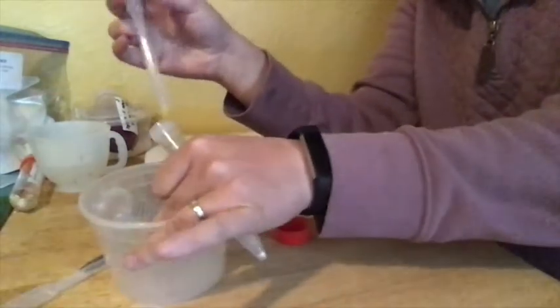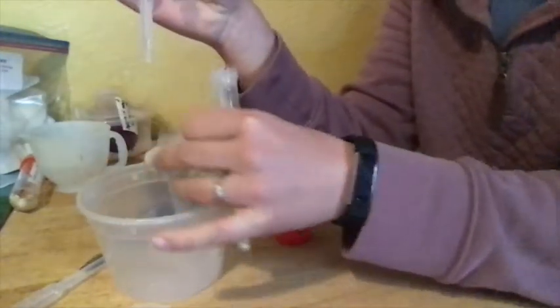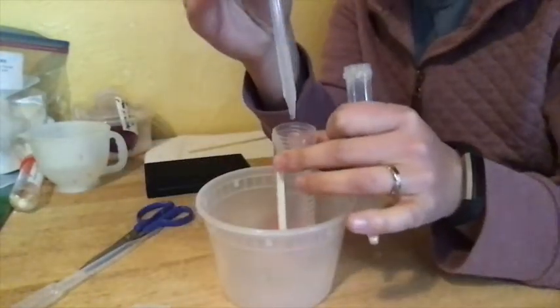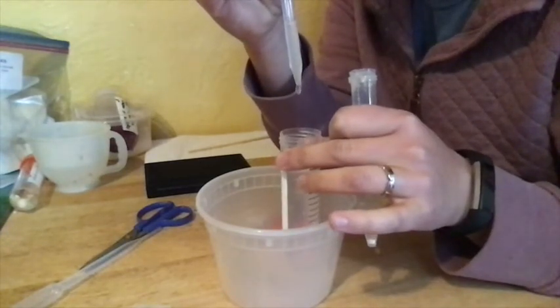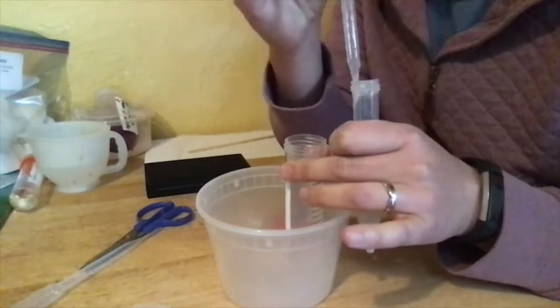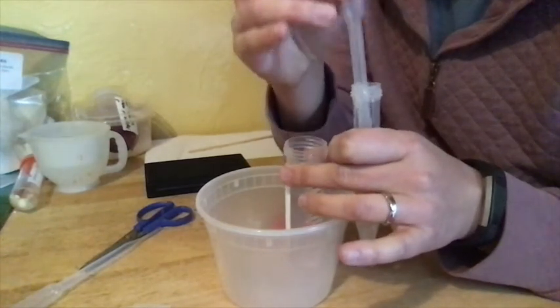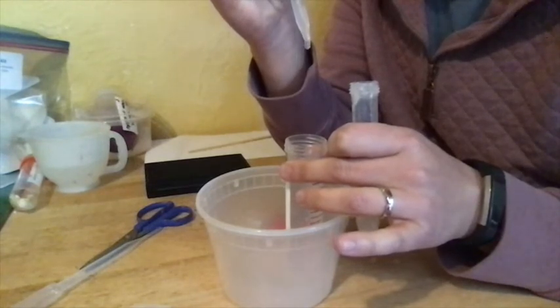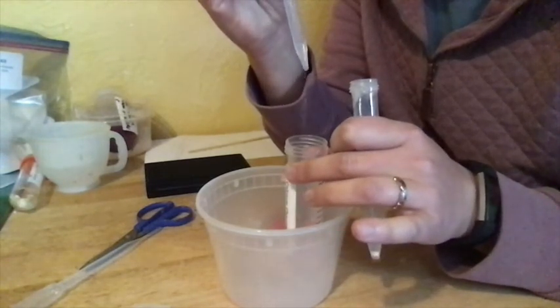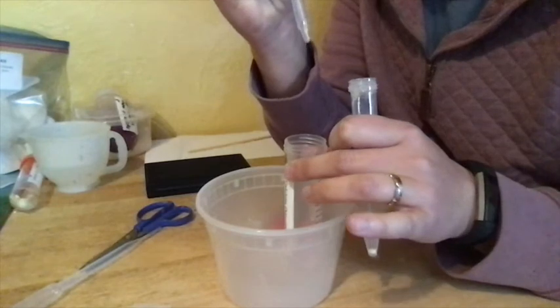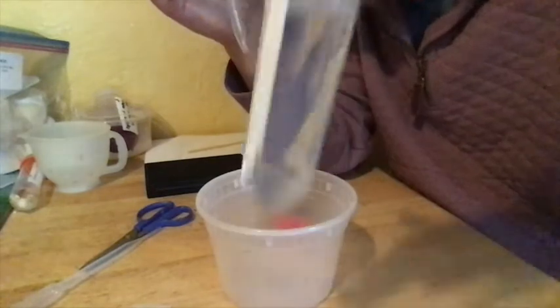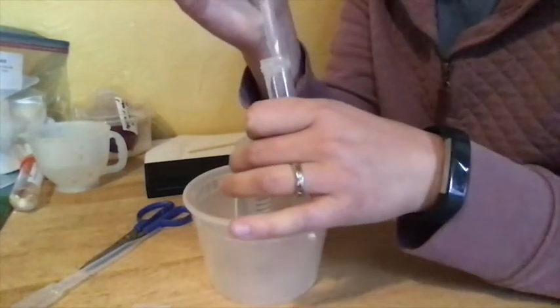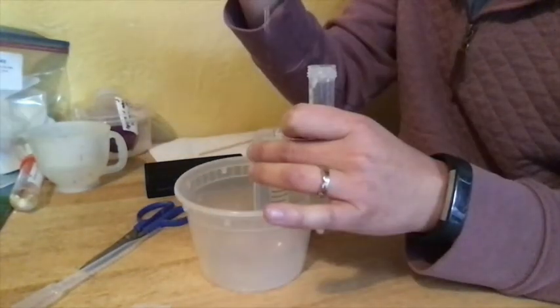And then you're going to draw up and you're going to create basically all the rest of the beads. You're going to use all the rest of your alginate solution. And you're going to drop it in drop by drop. And you're just going to keep going, you want to use up all of your sodium alginate solution. And you can see I'm getting a pretty good collection of drops there already. And just keep going.